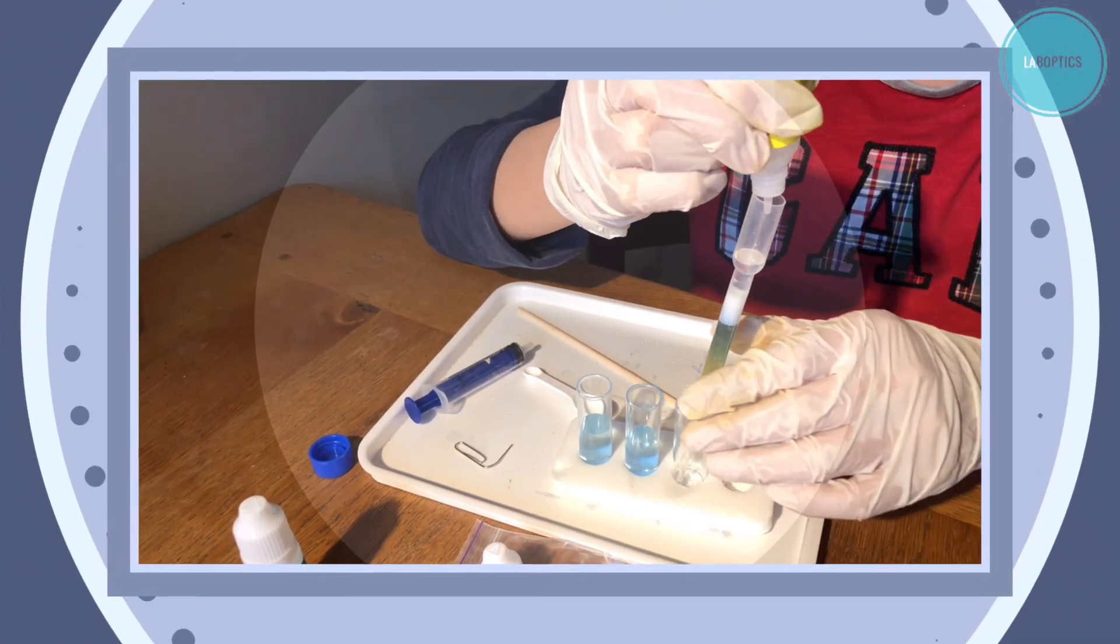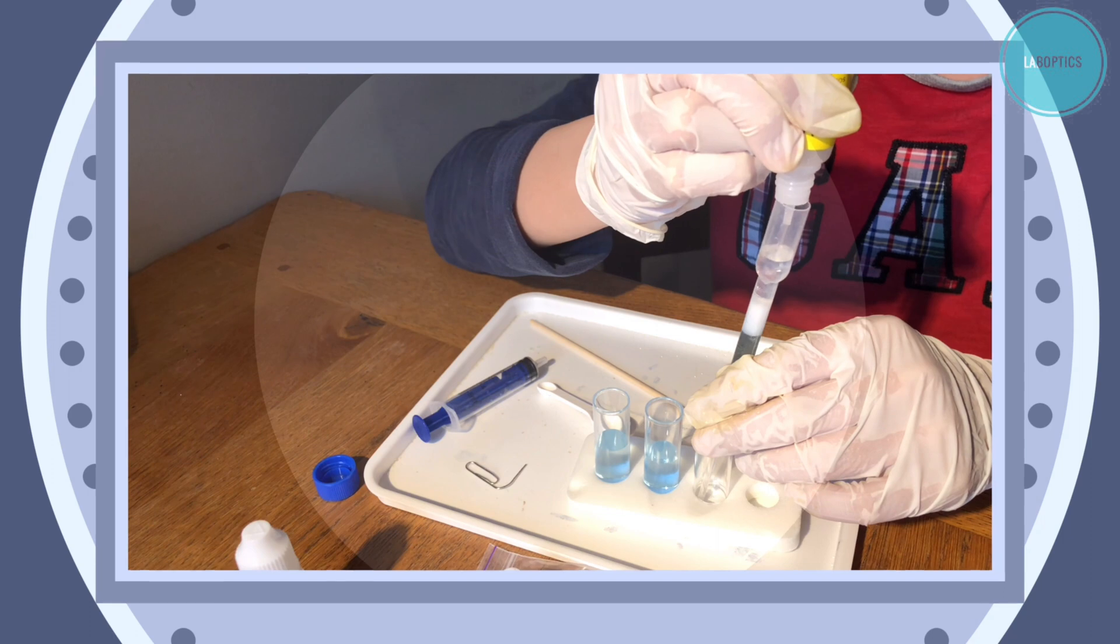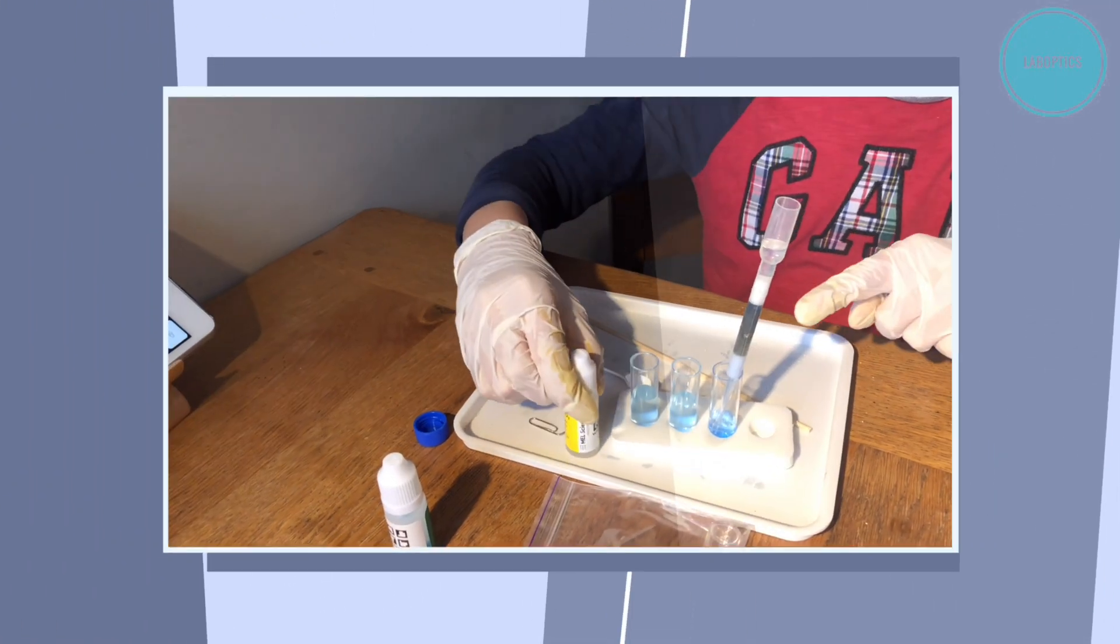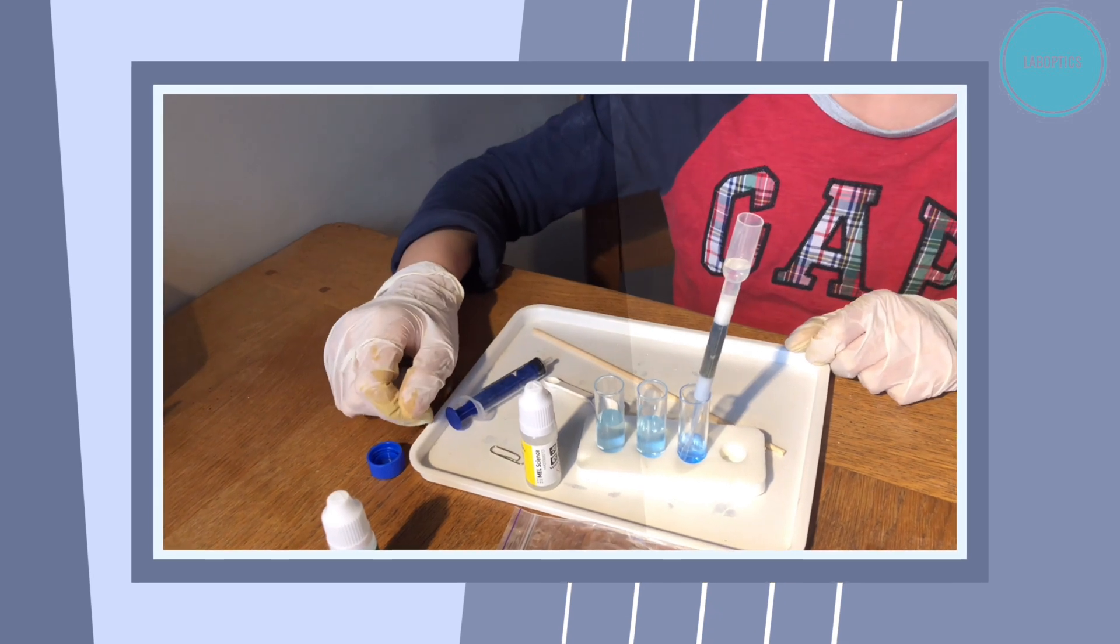Next we will fill our filter funnel halfway with the same ammonium carbonate solution. Observe the result.